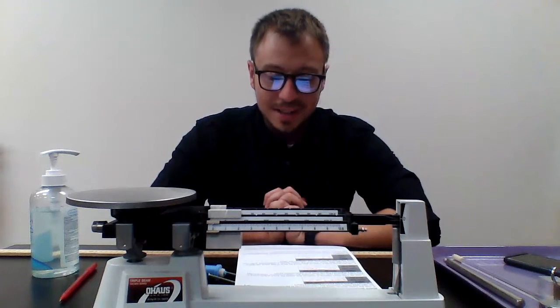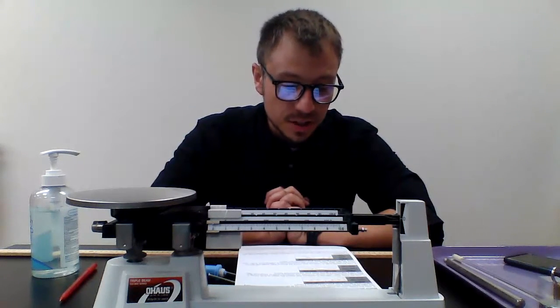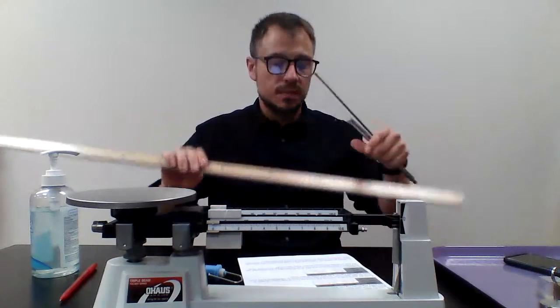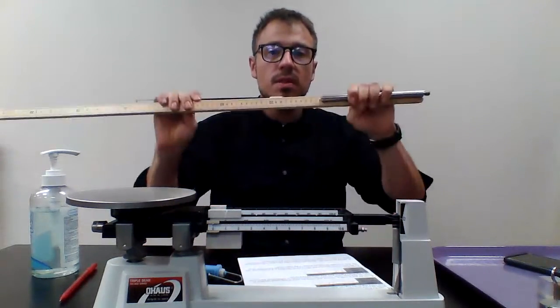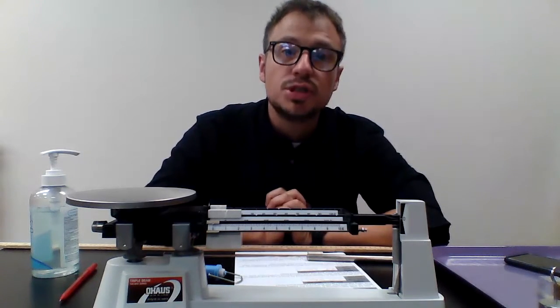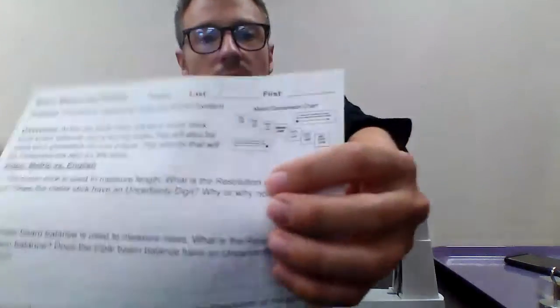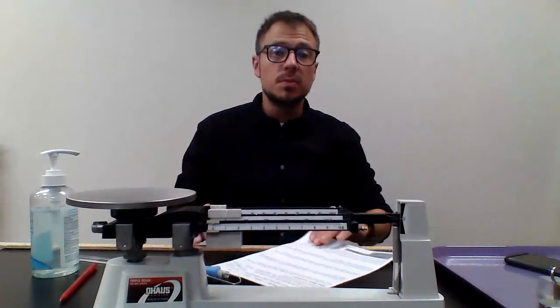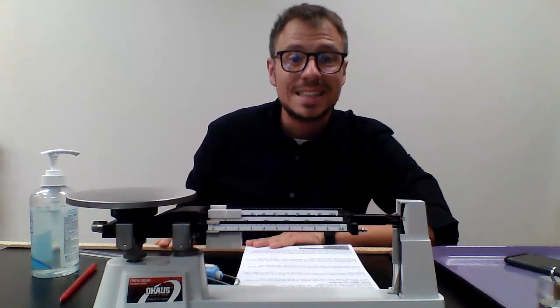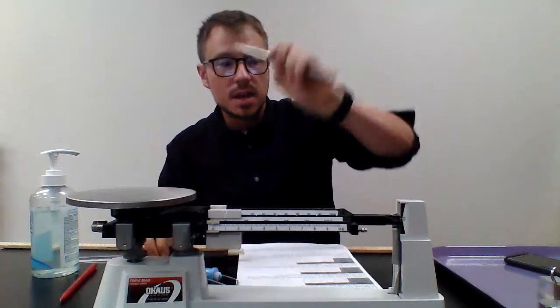We're going to use the meter stick to record the length of both rods in meters in the data table below, then convert those measurements to centimeters. How many significant figures does your measurement have? There are two rods — a plastic rod and a metal rod — and you're going to use the meter stick to measure the length of each. Then convert them to centimeters. In the metric system, you simply move the decimal point a certain number of digits. We start with the base unit meters and convert to centimeters.